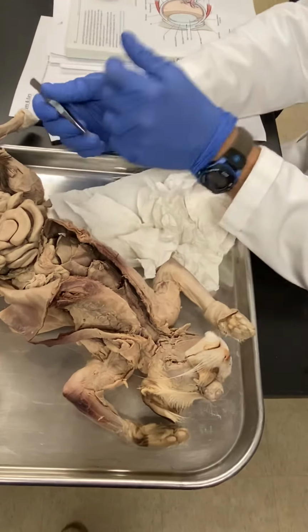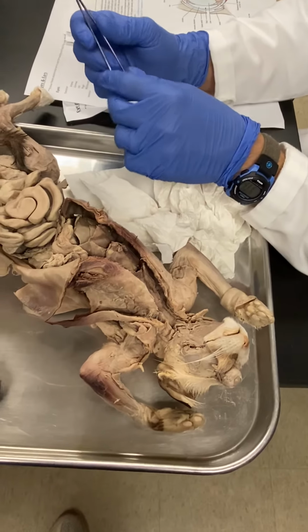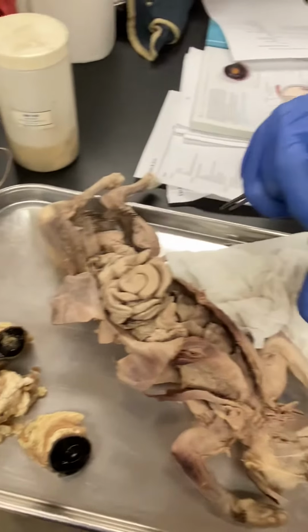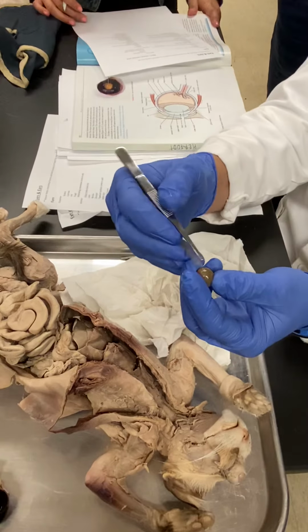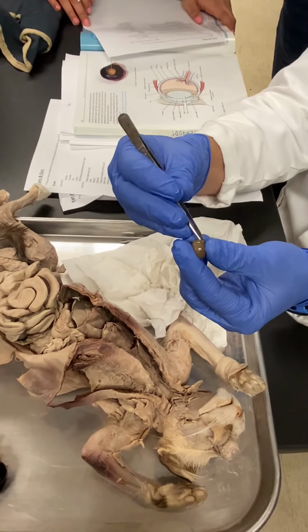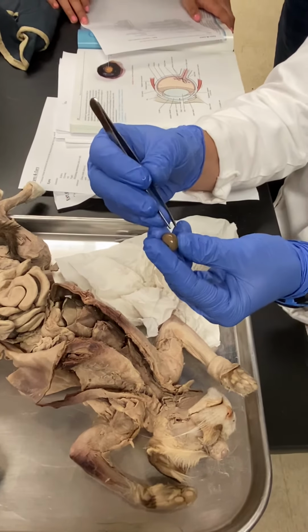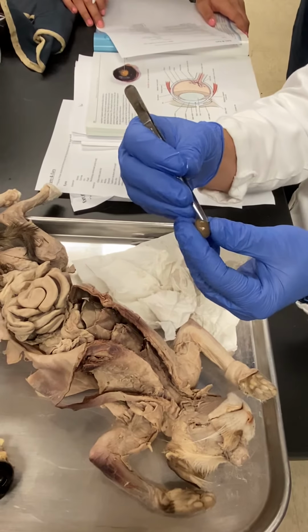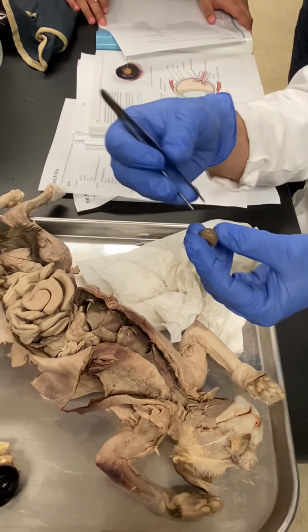Any other questions? What are cataracts? Cataracts. Okay, so this guy has a cataract because the portions inside the lens are a flexible material, but also not completely solid. And so you have the chemical structure breaking down and not maintaining its clearness. It's hardening and that sort of thing.